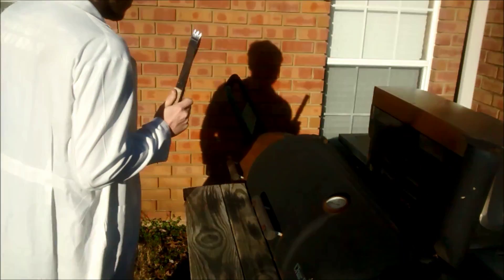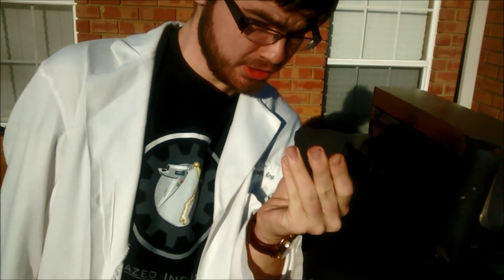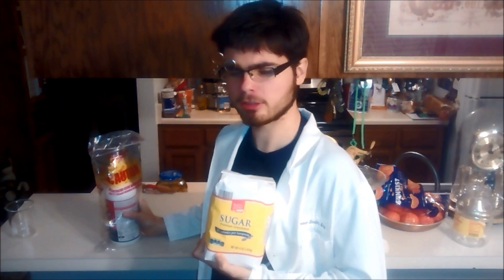So you're about to show up to the grill when you realize you have one very large problem: the last piece of coal. But that's no problem, because luckily you have sugar and sulfuric acid drain opener. And since you passed high school chemistry, then I'm sure you know what this means — we can make our own coal.